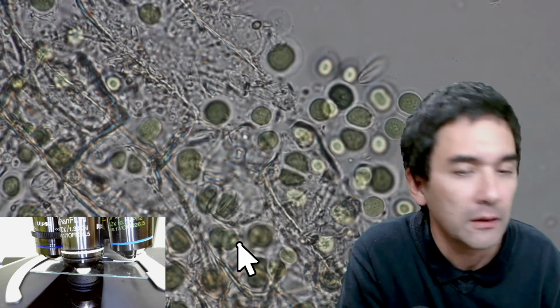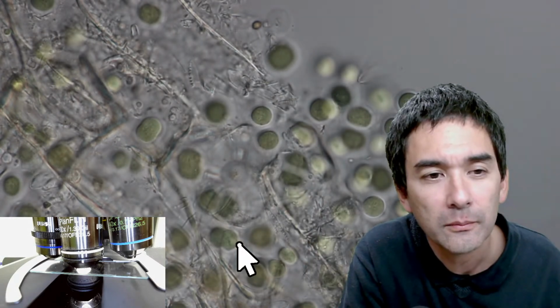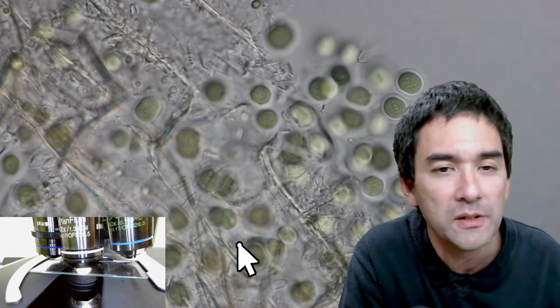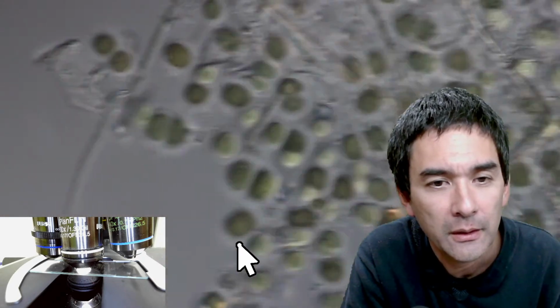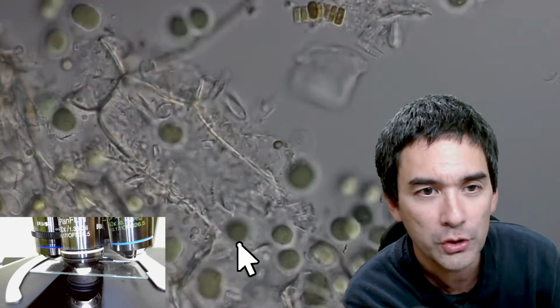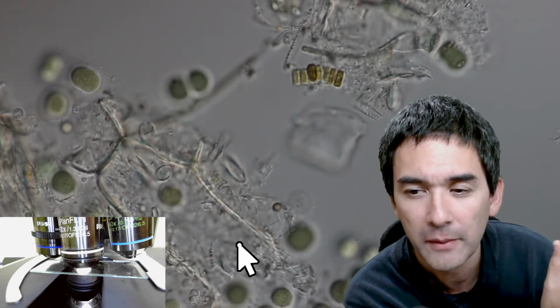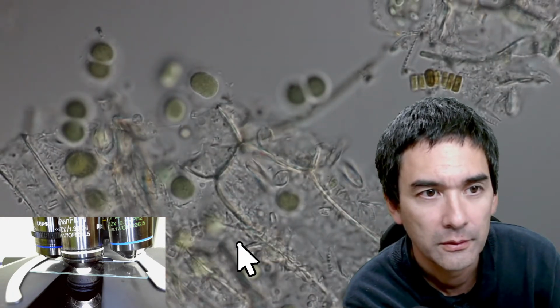And I can actually open the condenser a bit, go down with the light, and let's play around a little bit with the prism here. Okay. This looks green, so this seems to be some kind of algae here. And then, of course, I can still move around. But every time I move around, I'm also creating an oil smear on the cover glass. And if I do this too much, then I might have to reapply some of the immersion oil, because otherwise the oil film might rip. Yeah, and there was the movement over there. Okay.